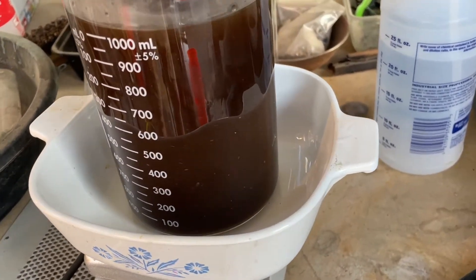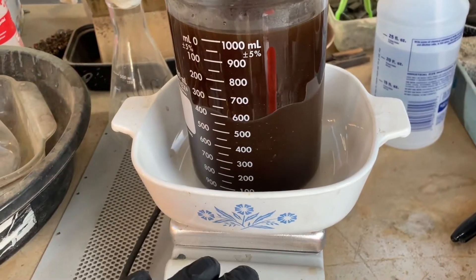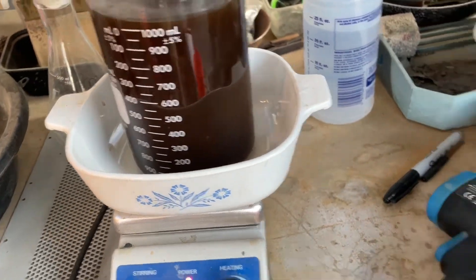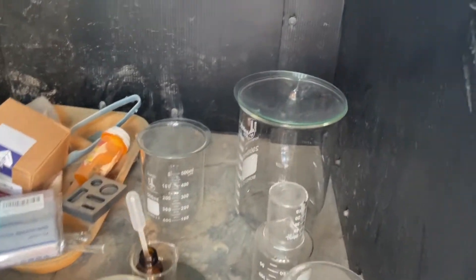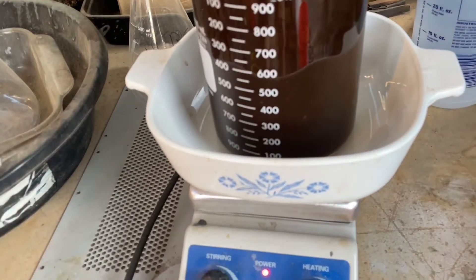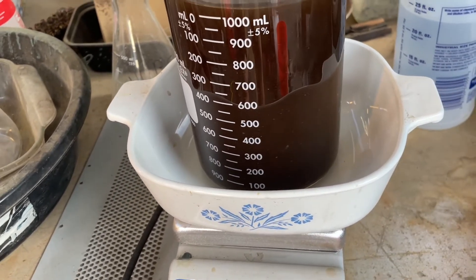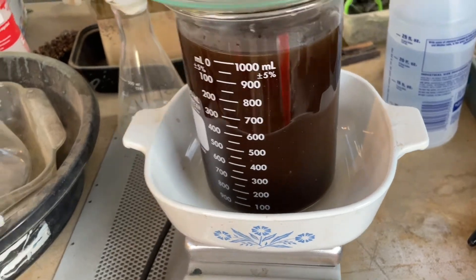Just mixing it up here and heating it up, getting it prepared for tomorrow. Tomorrow should be all settled. I'll pour off the clean stuff into a clean big beaker. And then the stuff on the bottom, I'll look at it and just smell it up and see what it is and what it does.